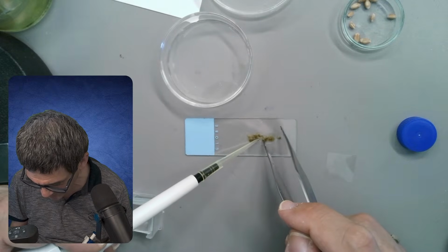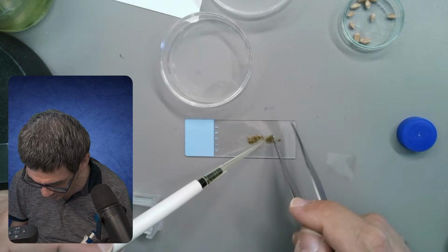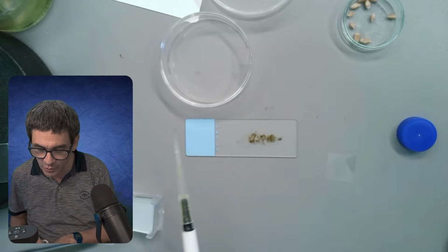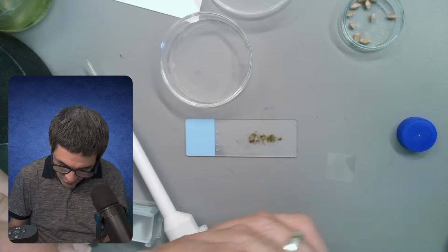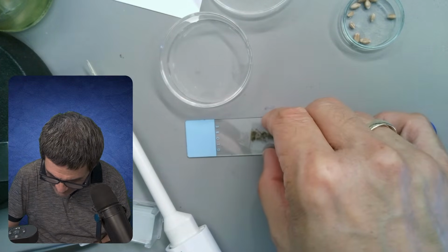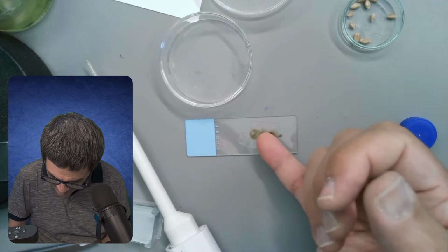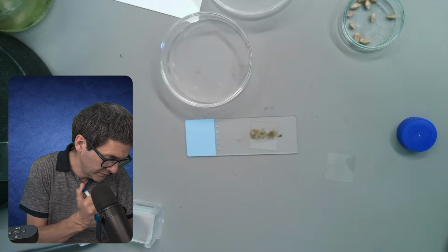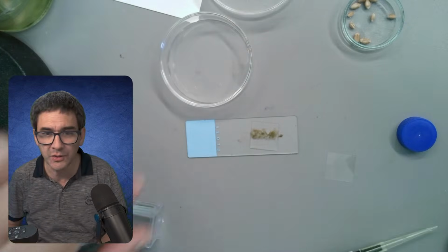Yeah, and what I also plan to do, I've got so many plans, is extract the diatoms using hydrogen peroxide. If I add hydrogen peroxide to those algae, it is going to digest away everything that's organic, and it will leave the silica cell walls of the diatoms. And this is something that sometimes also looks quite nice. Let's press it flat a little bit, and let's add a little more water here. So let's give this one a try.